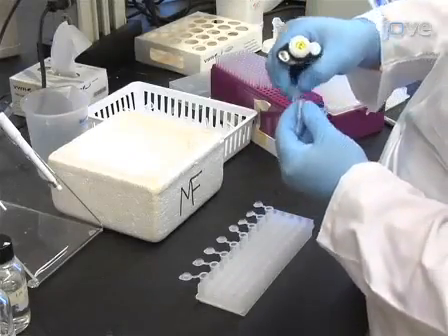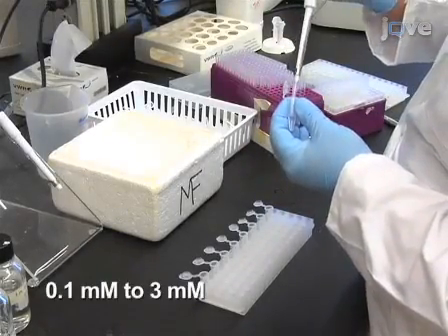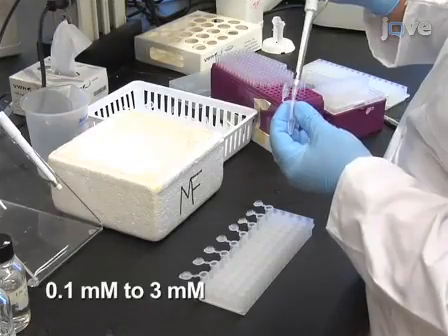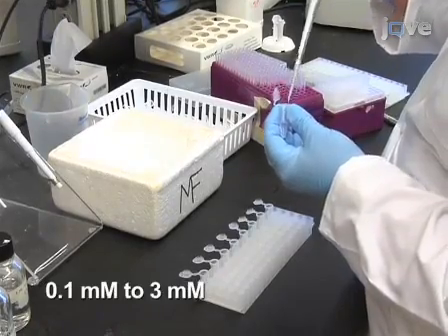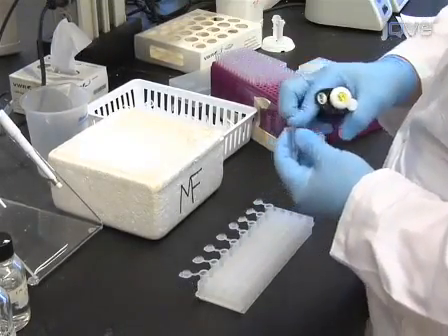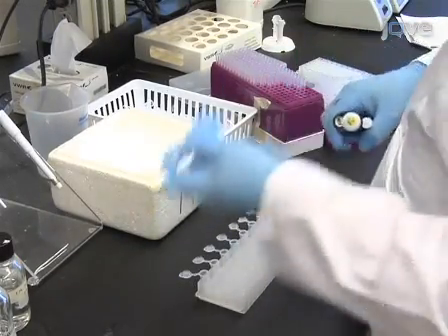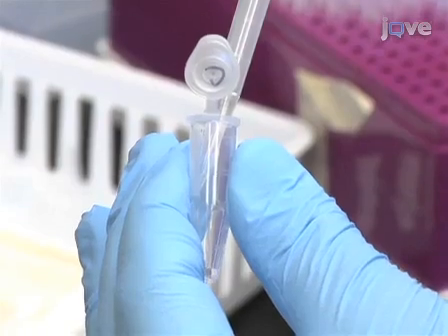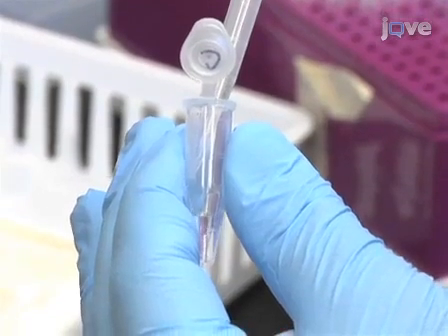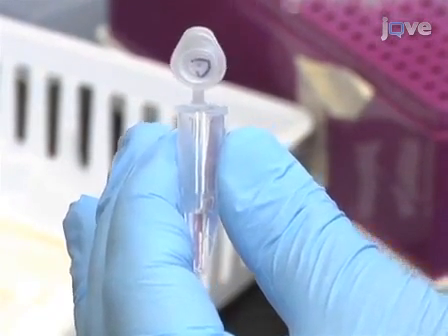For a standard curve of 6 to 8 points, dilute the acetyl phosphate stock solution in 100 millimolar Tris to a final sample volume of 300 microliters. Also include a control sample without acetyl phosphate.